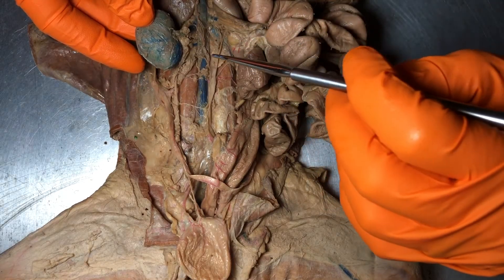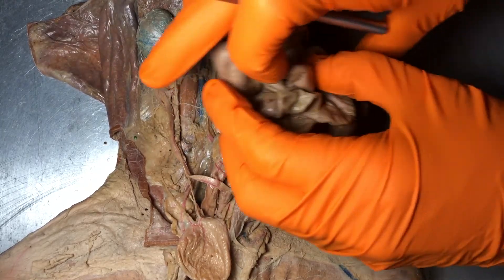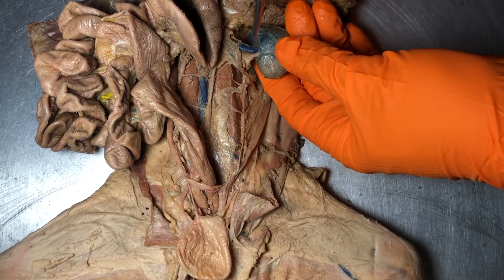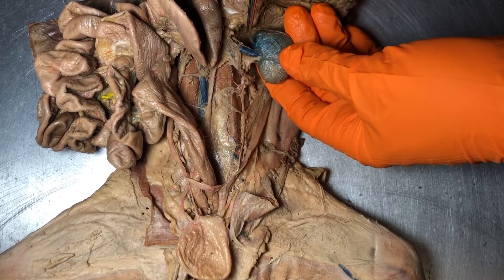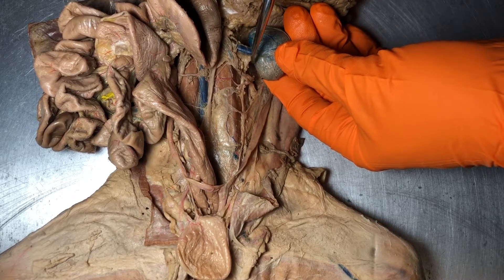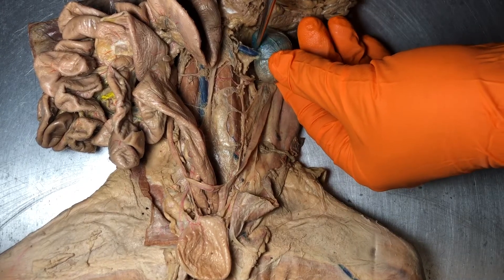On the medial portion of the kidney is this indentation, and that indentation is called the renal hilus or hilum. I'll show that to you on this side as well. The hilum or hilus describes kind of an entry into whatever organ you're talking about, and it will be for things like blood vessels or nerves. For the kidneys, we're also going to be referring to these ureters. The hilum or hilus is that indented portion — it doesn't matter which form of the word you use. That is not a singular or plural form; it's just two alternative spellings of the same thing.